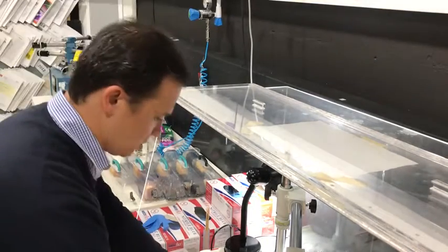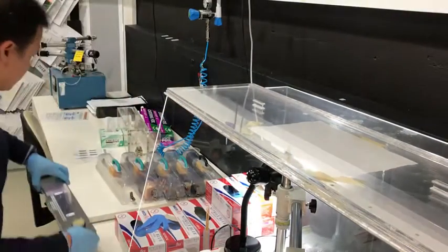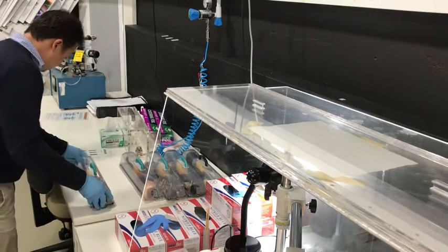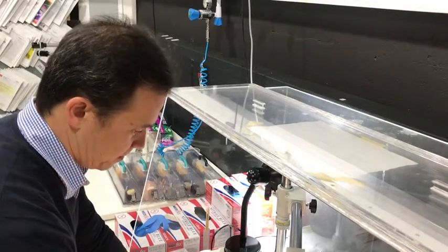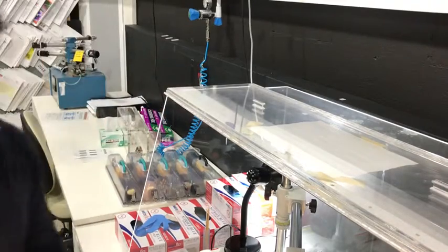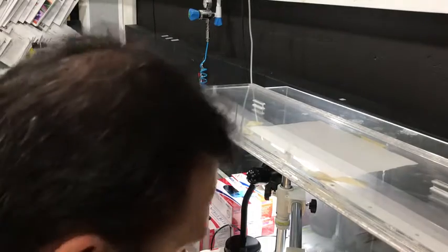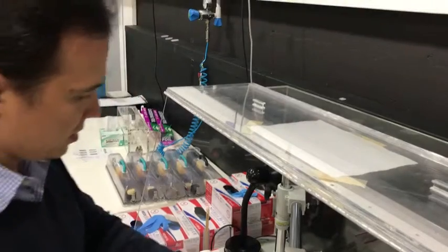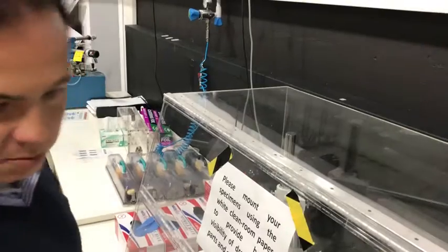I'm just going to remove the specimen holder stand to where it should be located, which is out here. Now I'm going to clean up the paper that I put down on the bench. Turn off the vacuum tweezers, turn off the light, turn off the internal light, shut the hutch, and that's the specimen done.